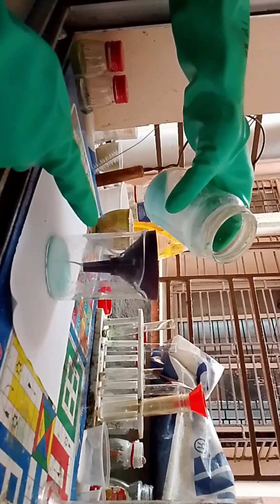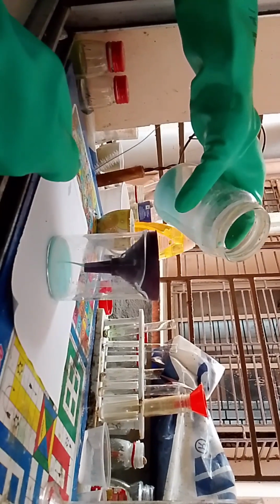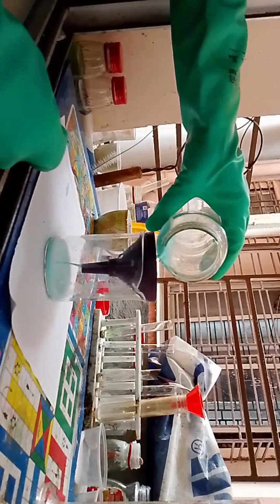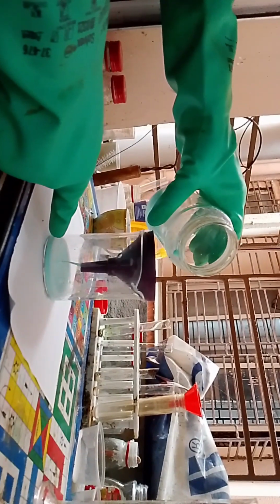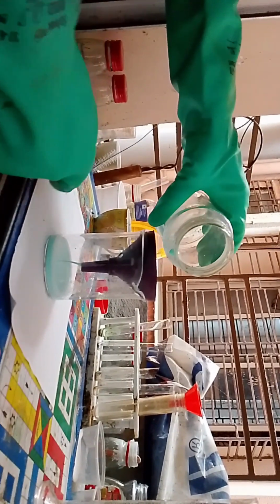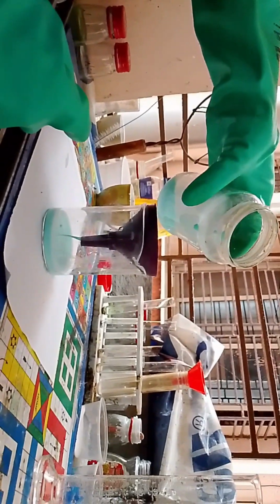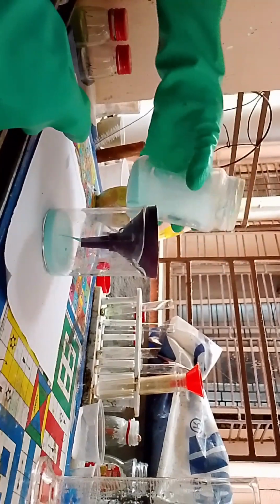But during filtration I noticed something rather odd. It was like an illusion. Balls of copper oxalate were floating like this. Balls are floating around, like it appears to be balls floating around. Wait.